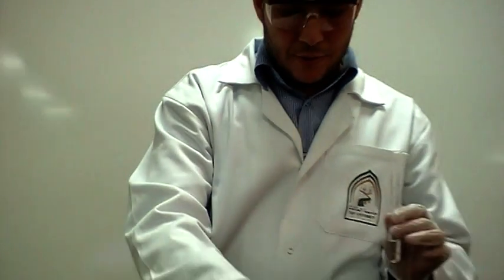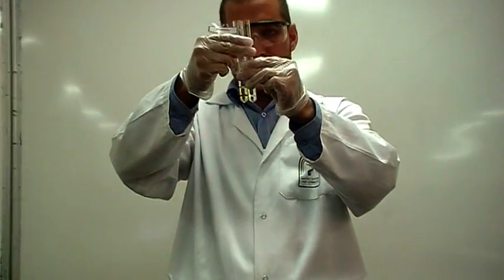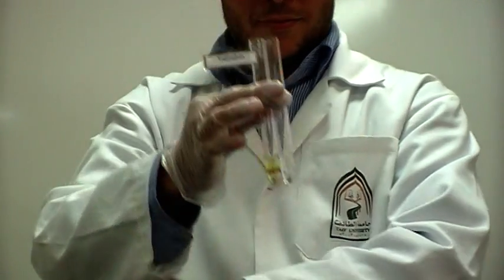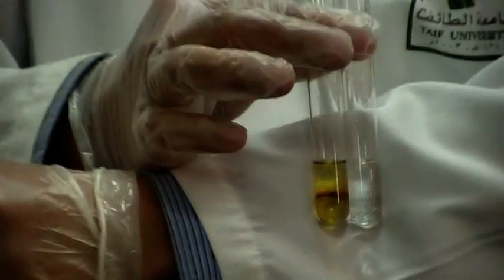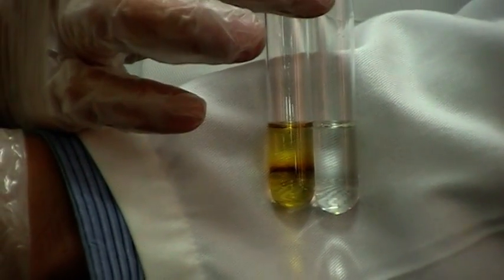Just put the next to each other and see the difference. The ring means we have tryptophan. No ring means we don't have tryptophan. Thank you.